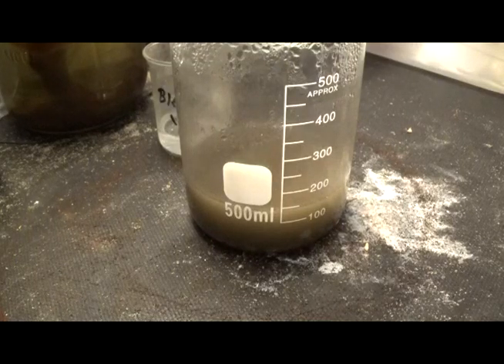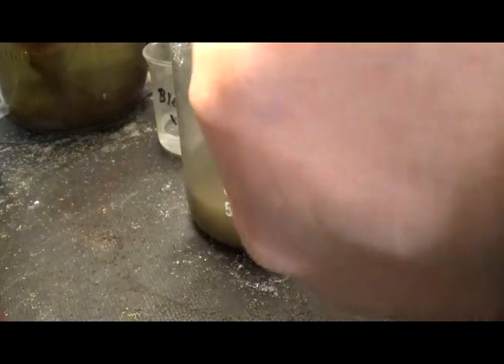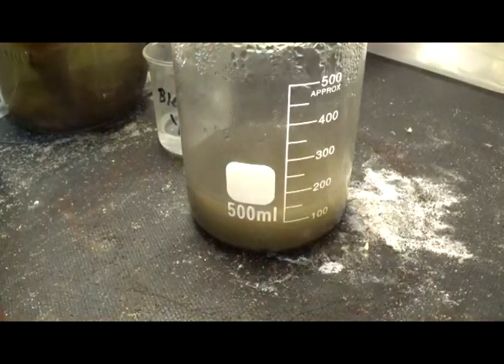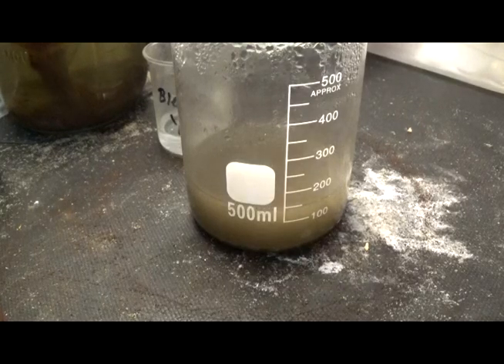A sulfur dioxide gas generator, you know, and just create the gas to do it. Because that's what does it. That's what drops the gold out. It's the sulfur dioxide gas that's created when you mix sodium metabisulfite with hydrochloric acid. We're going to do a stannous test. Do this off camera because I don't want to catch a whiff of that junk.